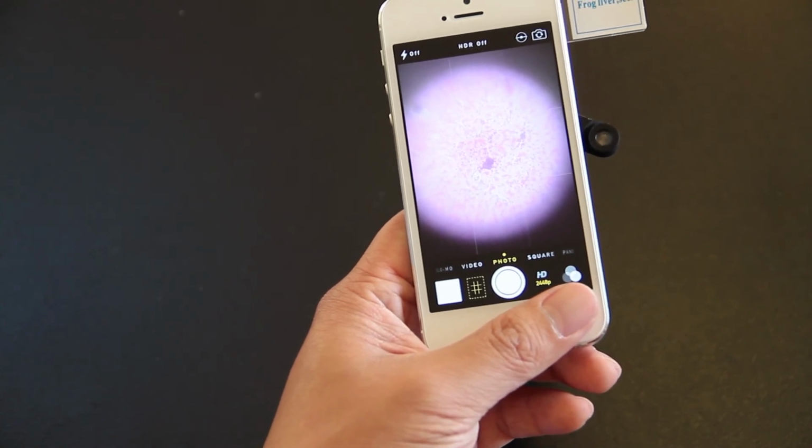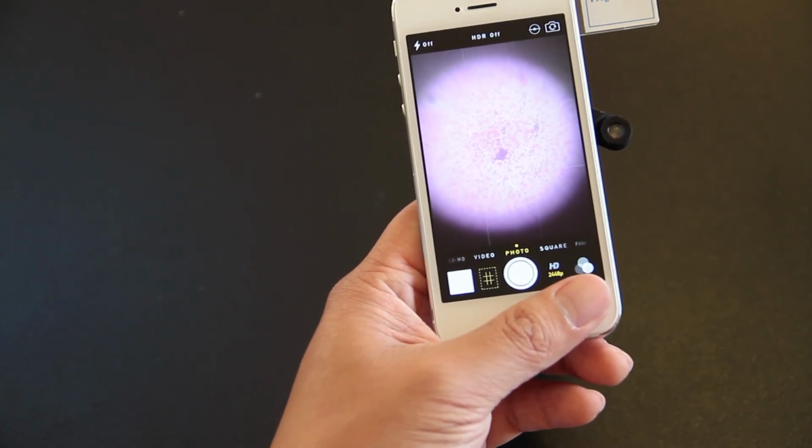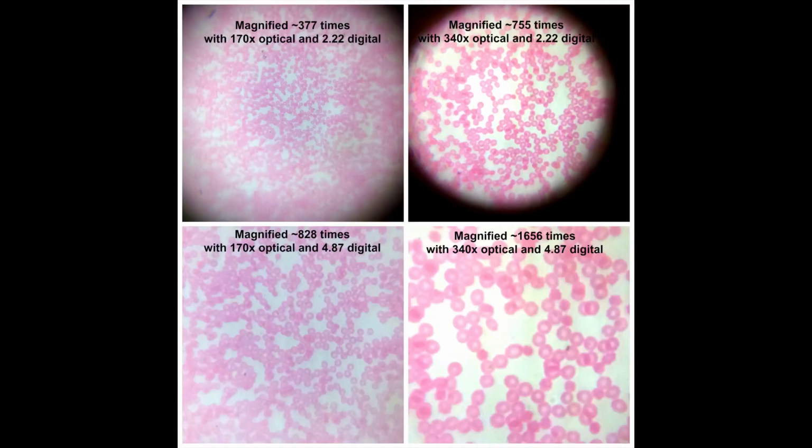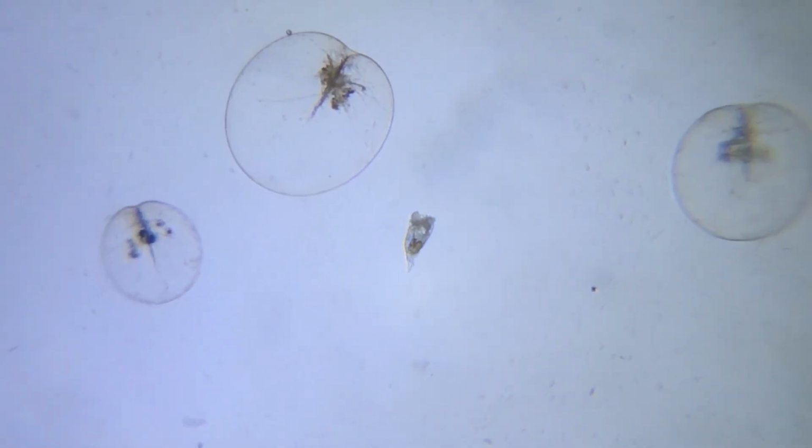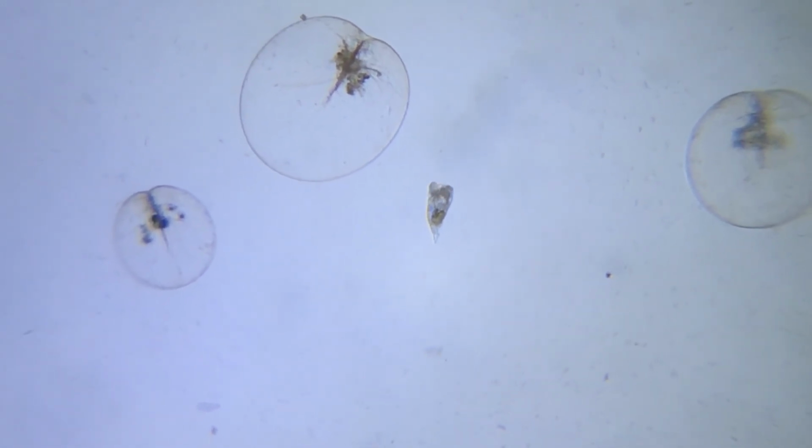And so if you're wondering about the microscope I'm using here, it's actually a microscope I designed myself. And I like it a lot because it's powerful, it can produce over 1,000 magnification, and it's really versatile. A 10-year-old might use it to satisfy their curiosity, but a PhD or other professionals can use this to satisfy their needs.